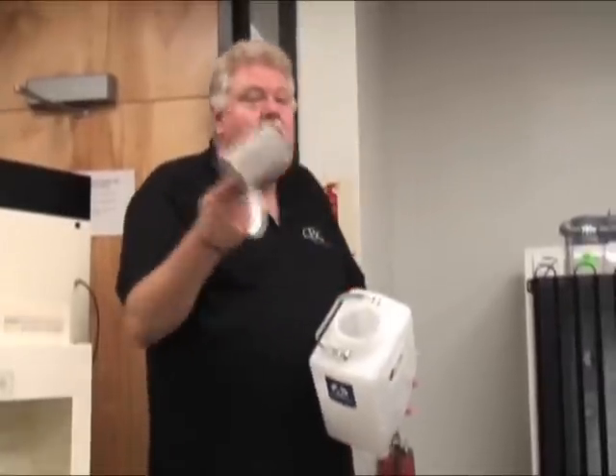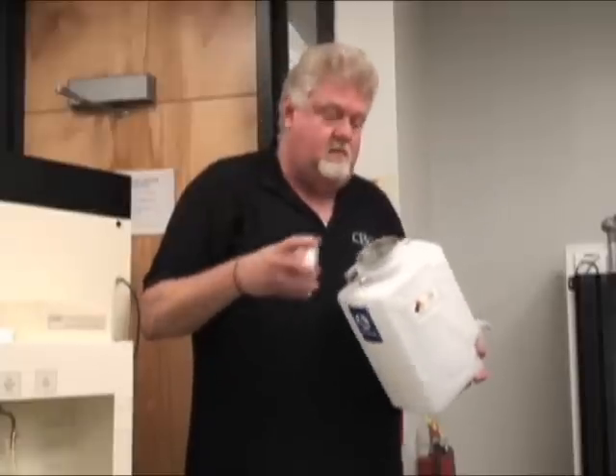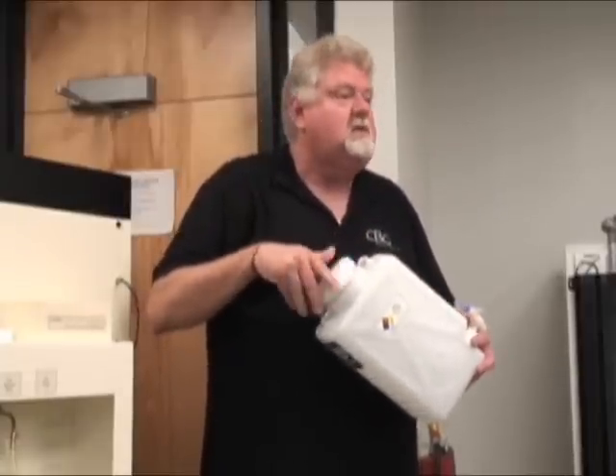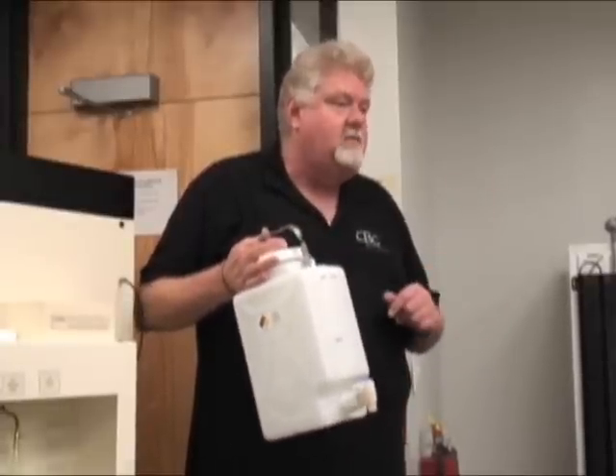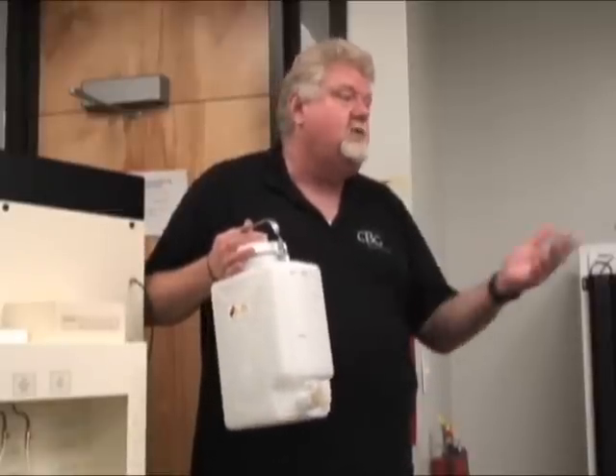These metal mesh strainers should virtually last you forever unless you step on them — don't step on them. You can leave these in the container, pour directly in, put it on the machine, start it, and walk away. Limitations: every xylene can be recycled. You need at least a solid gallon, up to the zero mark — anywhere in that parameter is fine.